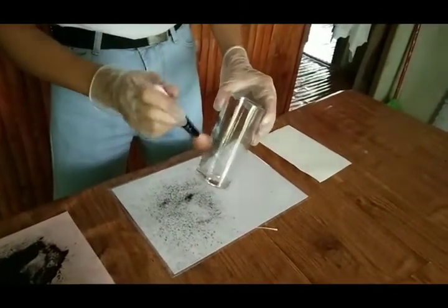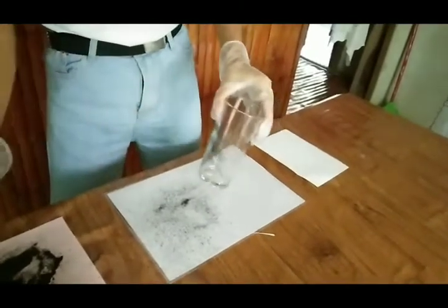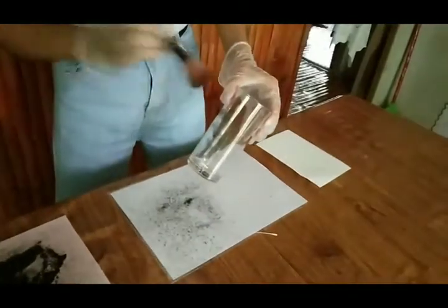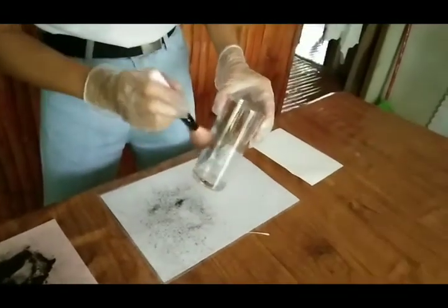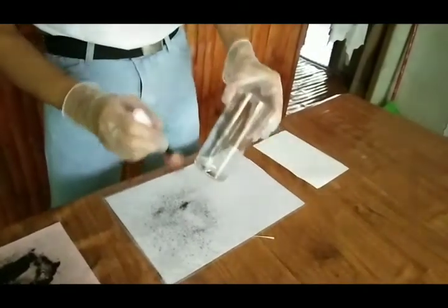When the powder particles adhere to the grease or moisture forming the latent prints, it causes them to become visible.